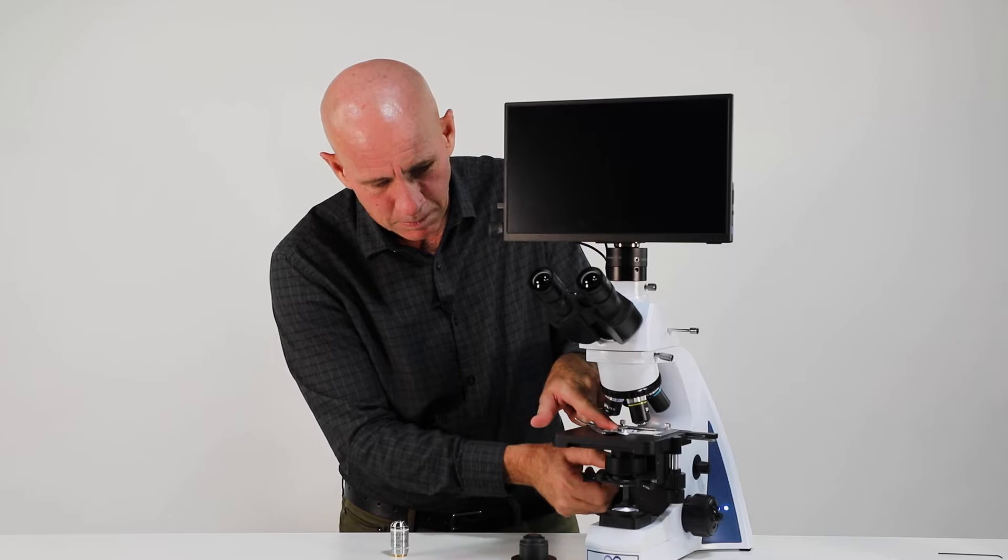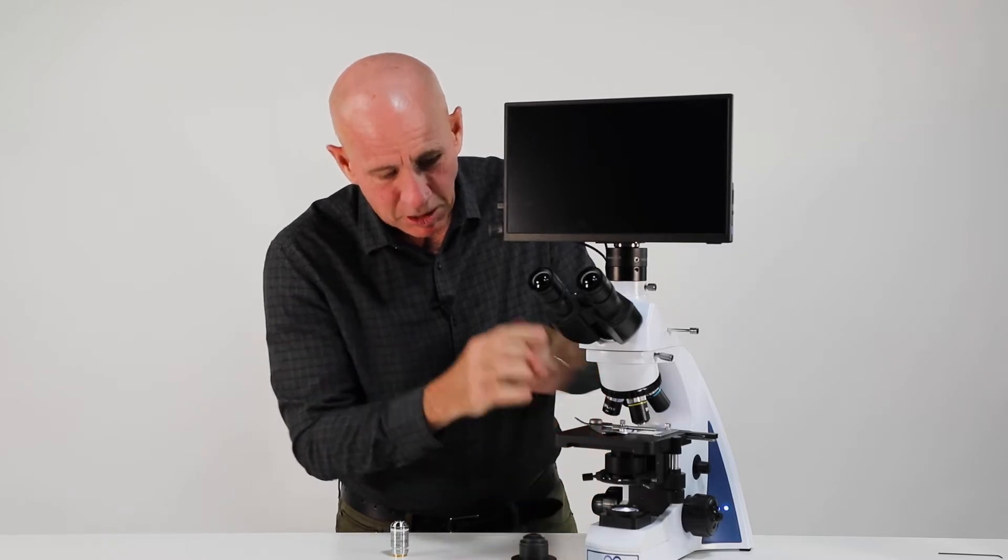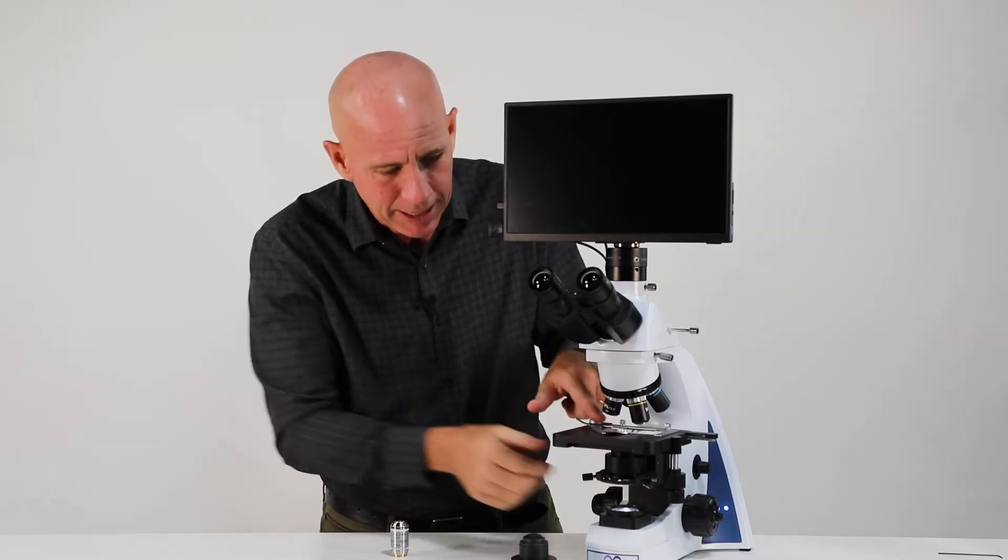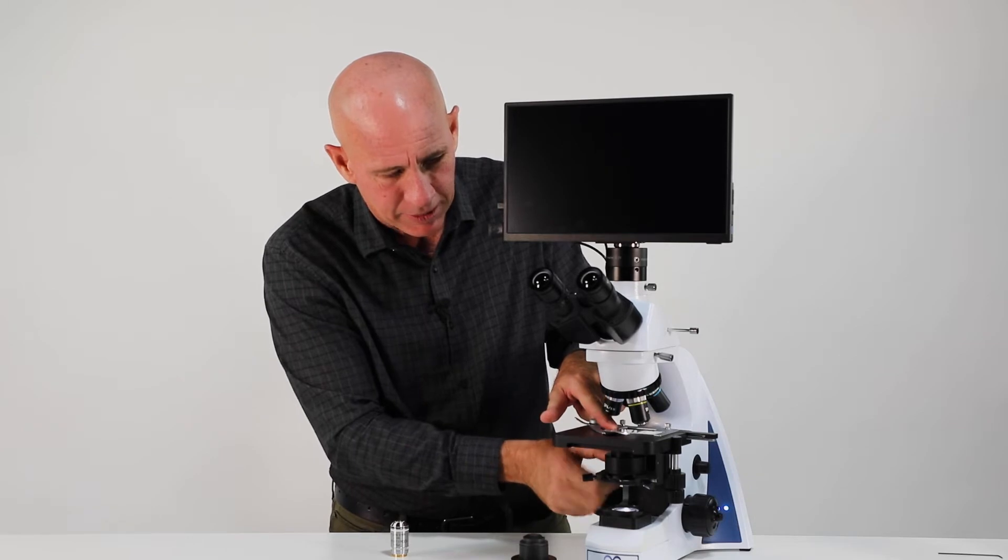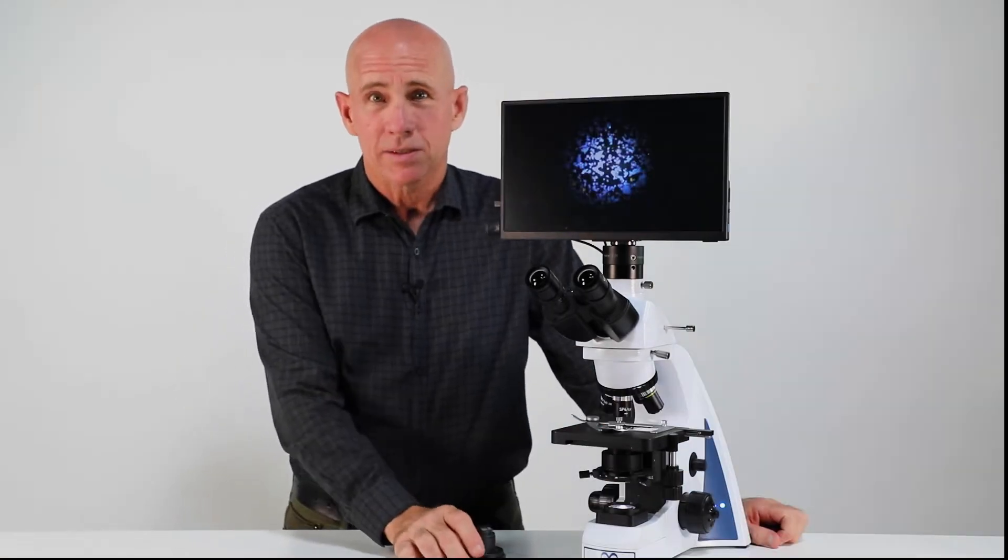So again, hold my slide. I see my oil getting wide, but I'm not knocking my slide out of place. Okay, for the next part, now that we've got our height adjusted, we're going to look at alignment.